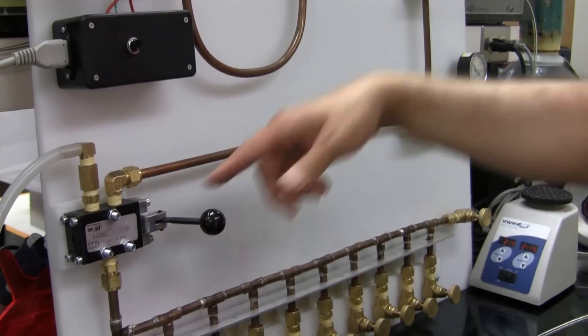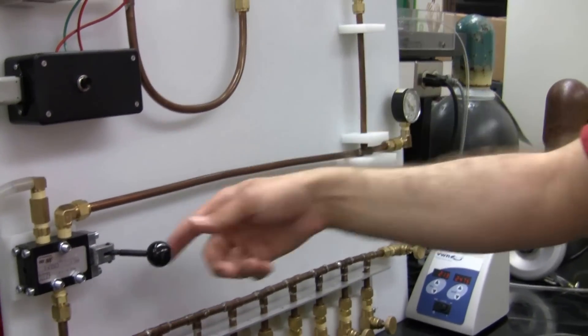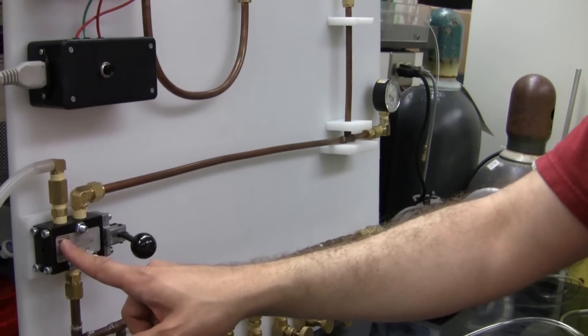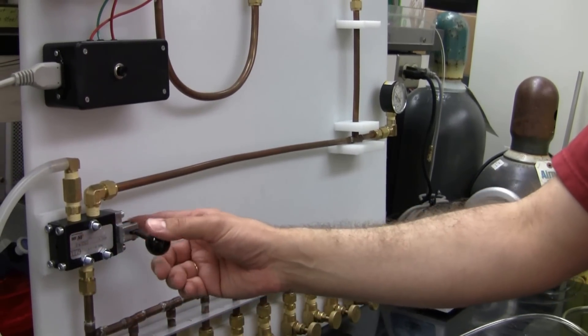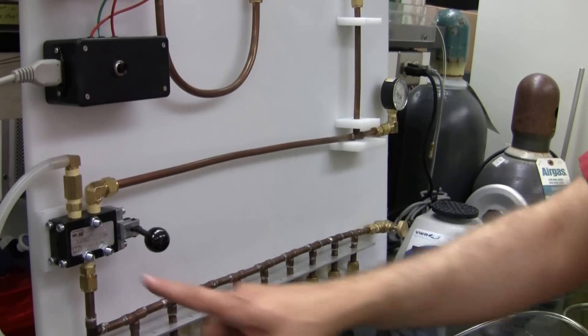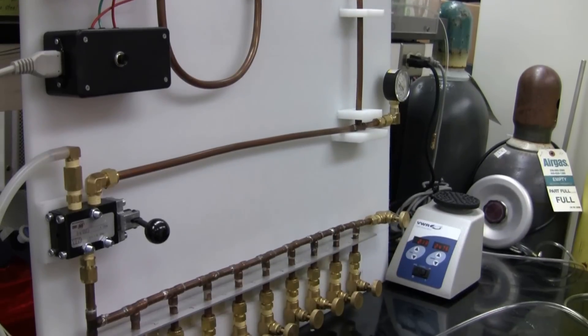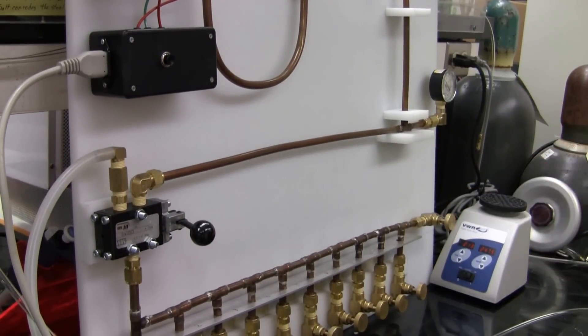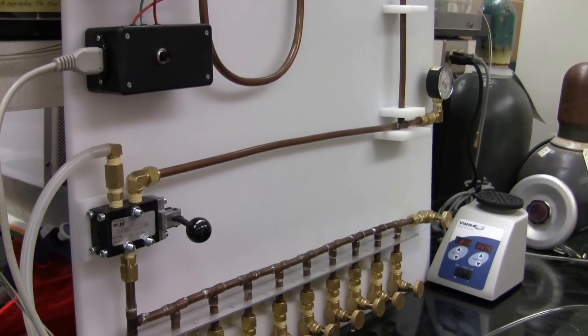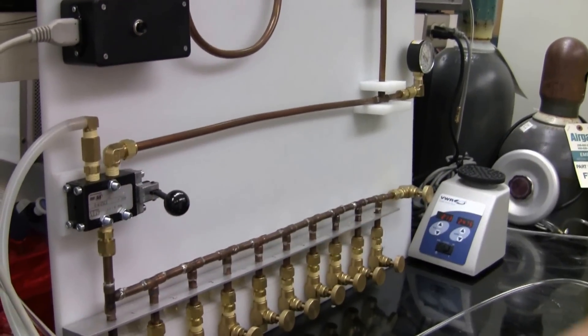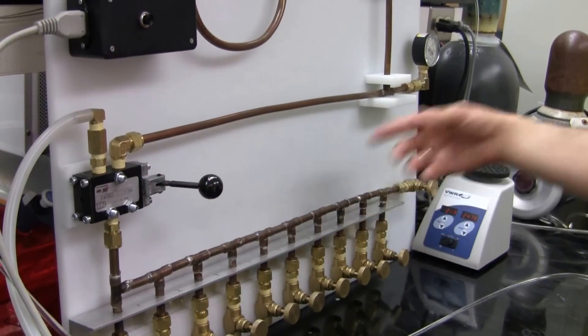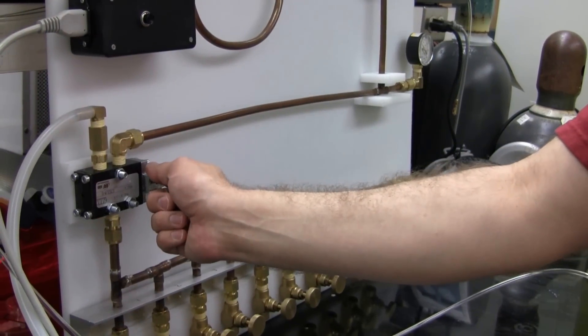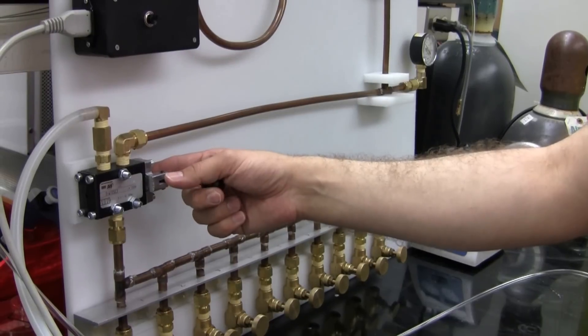Pressurize, wait until it is zero, vacuum. Sometimes you might hear this little sound, like a little whistling. Just jiggle this thing. It's some technical issue with that particular type of valve. It is not broken, but it's just the way it is. So, you do it several times. Pressurize, pressurize, pressurize, vacuum. Pressurize, vacuum.